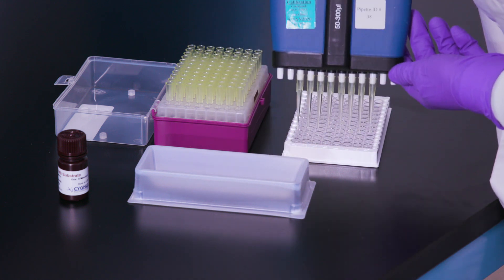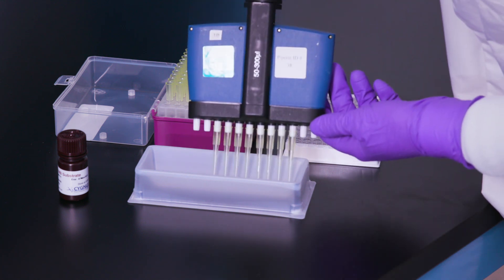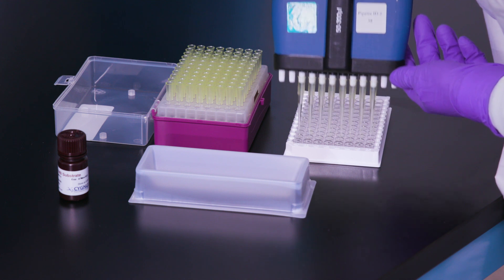Be sure to add substrate immediately after washing. Do not let the wells dry out, as some enzymatic activity will be lost.